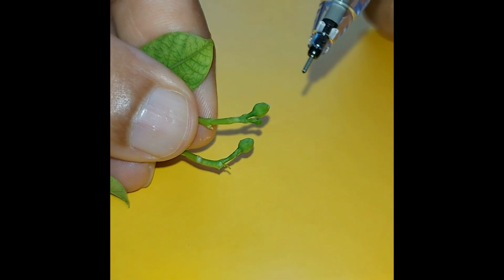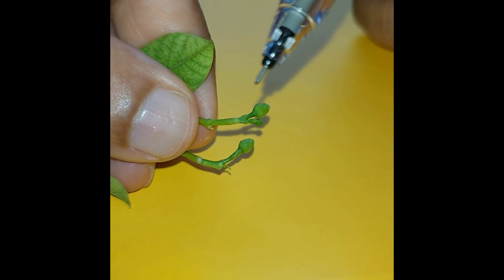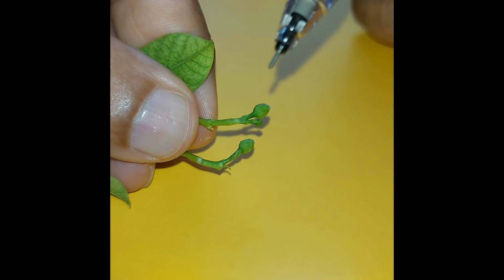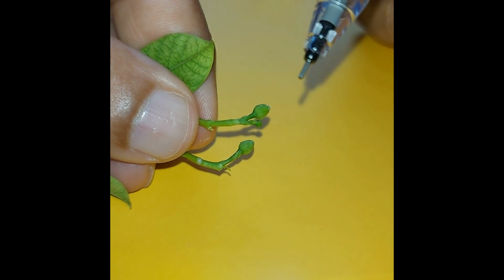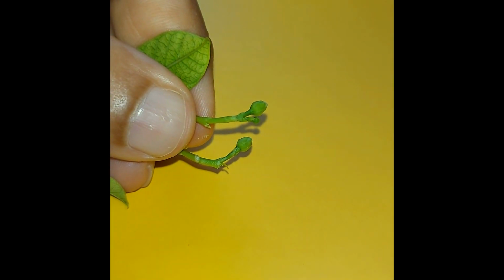sepal first. Now since plant cells have cell walls, this cell wall is actually very tough, thick, and very fibrous. So when it's against the elements, you will see that the sepal itself is very resilient and it holds the very soft petals inside. This will protect the plant, and most importantly it has to protect the ovary and also the ovule.